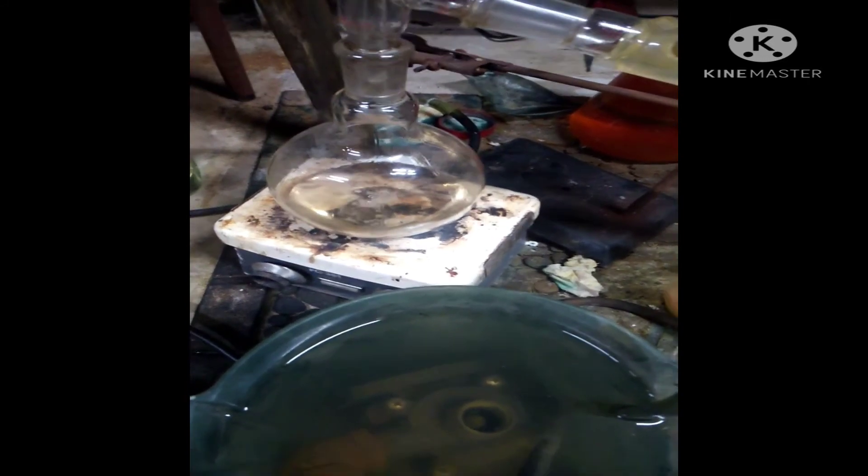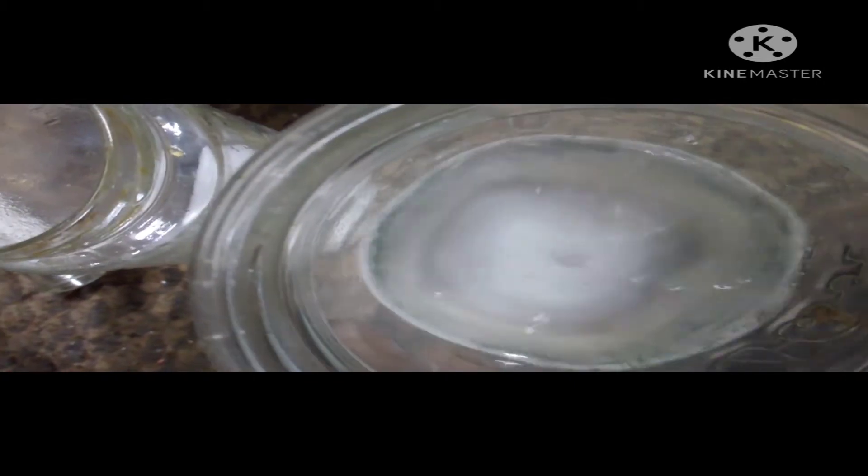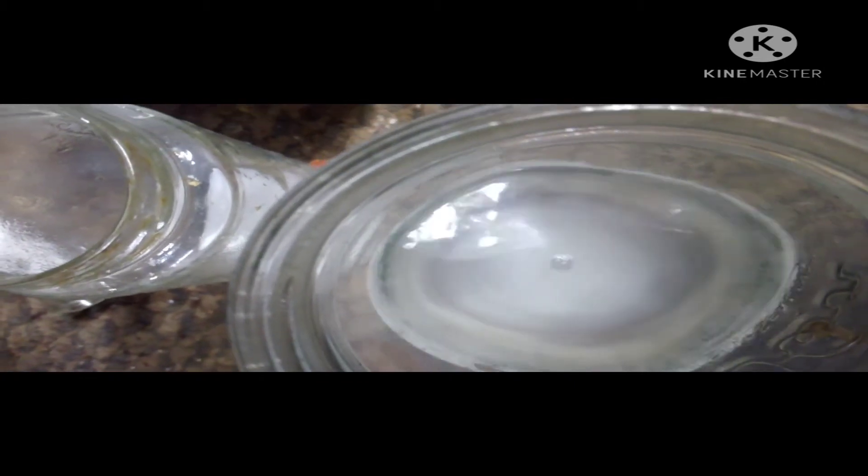Distillation is done now. I'm going to put all the ethyl acetate into one container and then add some sodium bicarbonate solution to take care of any remaining acid still in solution. I have a baking soda solution here and here's my ethyl acetate — let's see if there's any reaction. It looks like there's very little, so that's good. Now I'm going to put this in the separatory funnel, separate the phases, discard the aqueous phase, and keep the organic phase.